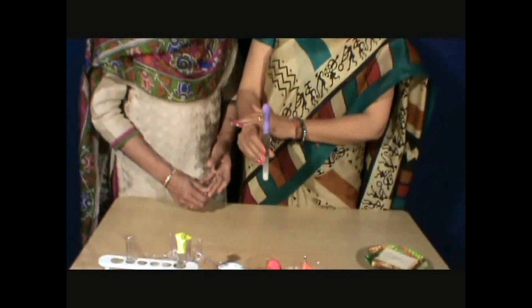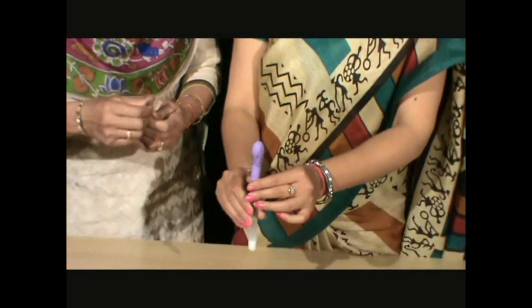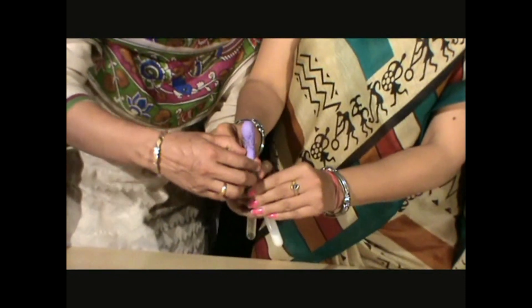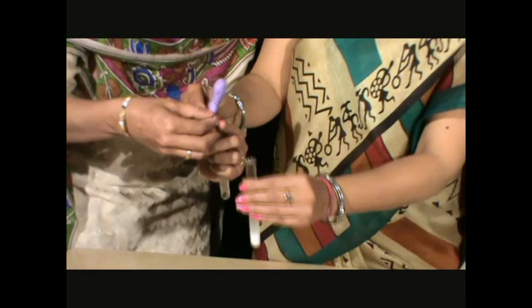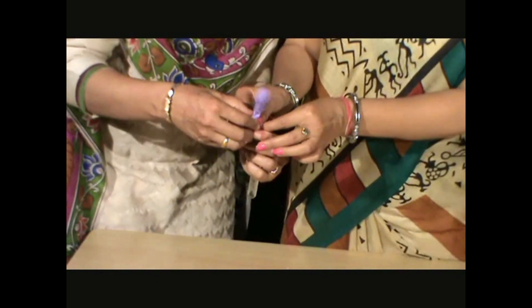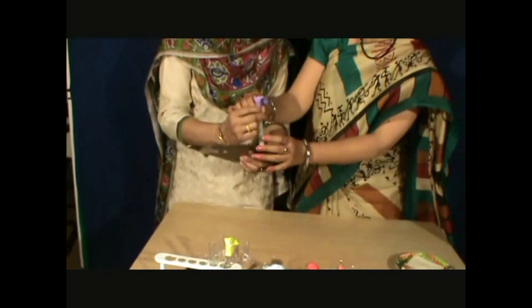How can we test that this is carbon dioxide gas? We can test it with the help of lime water. We will take lime water in a test tube and then transfer the inflating balloon from test tube A onto it and tie it. We will remove it very slowly so that the gas does not escape. Should we shake it?